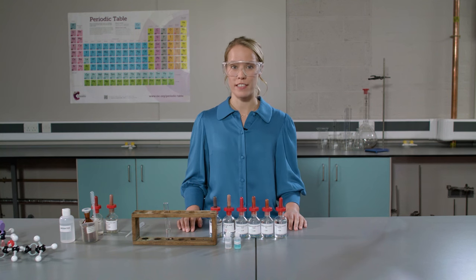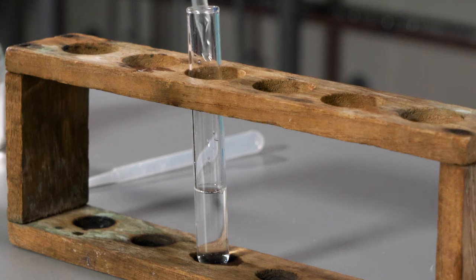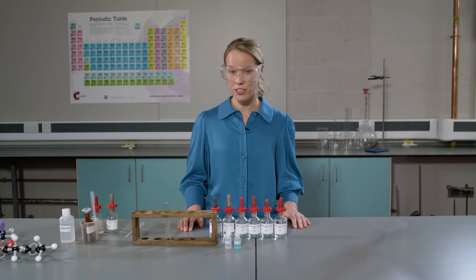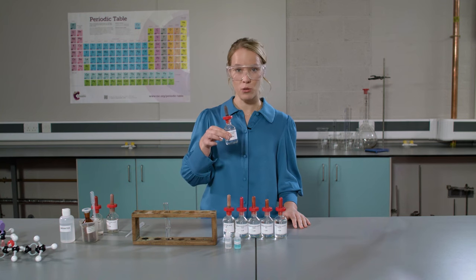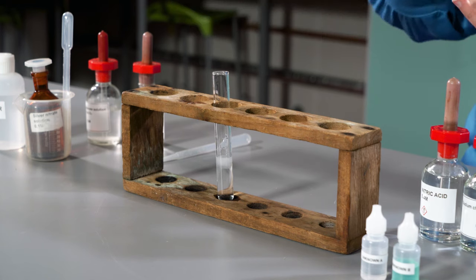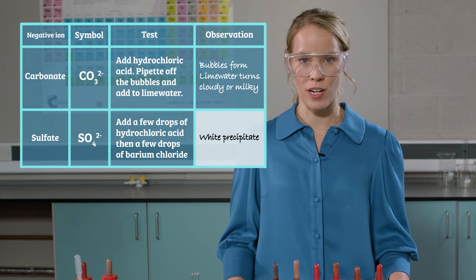Now I'm going to test for sulphate ions. This is sodium sulphate. I'm going to start by adding a few drops of hydrochloric acid. There were no bubbles, so no reaction, so no positive test for carbonate ions — but we knew that. Now I'm going to add barium chloride solution, just a few drops. Observe the white precipitate — this is barium sulphate. So the positive test for sulphate ions is that a white precipitate forms when barium chloride is added.